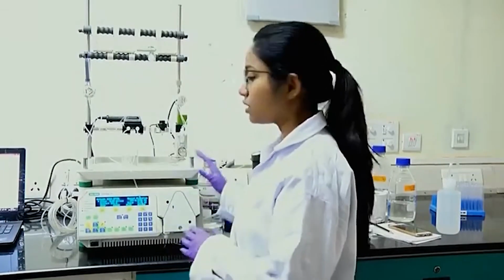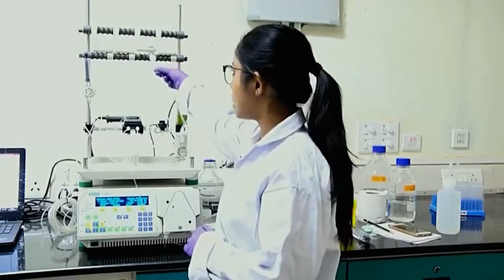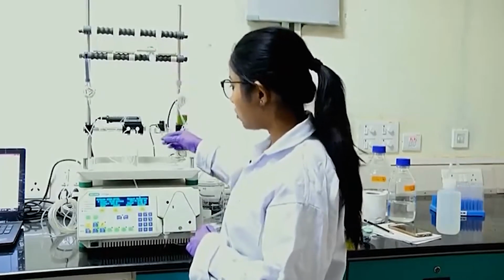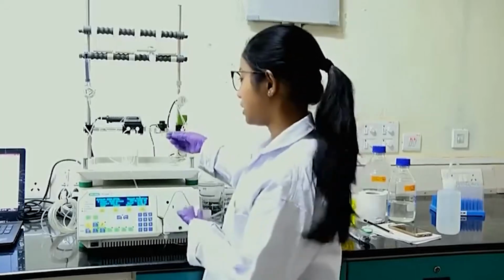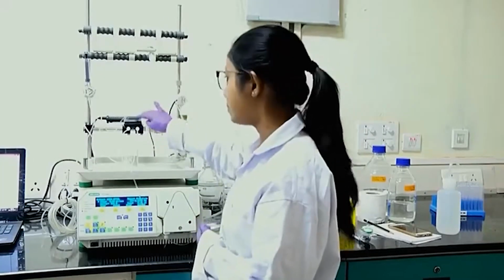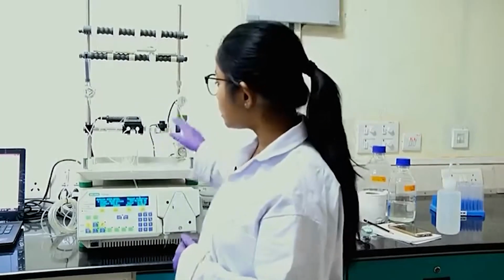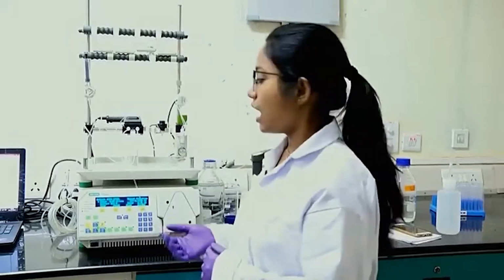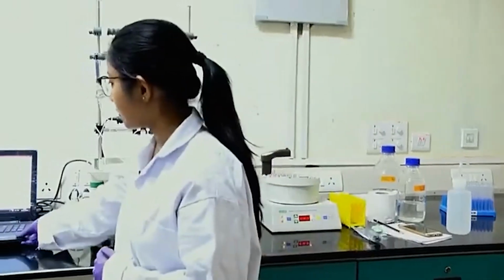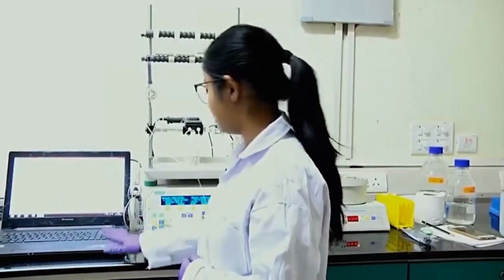Another thing which is attached to this machine is the computer system, where you can check the absorbance and the conductivity. From this column, the flow is coming out, the solution or whatever it is coming out and going through, passing through this UV lamp and the conductivity measurement instrument. So, these two values you can check. So, we have a monitor or computer attached to this system.